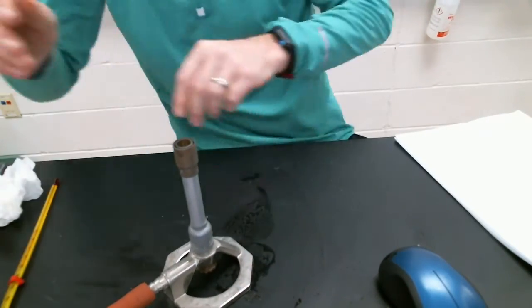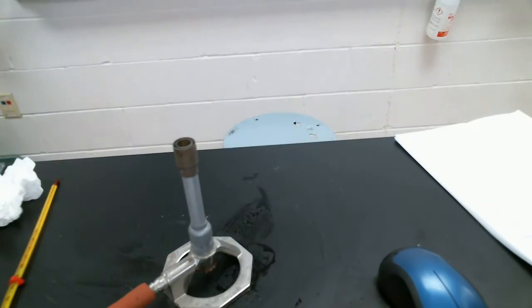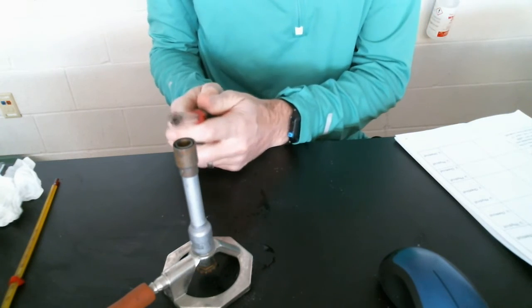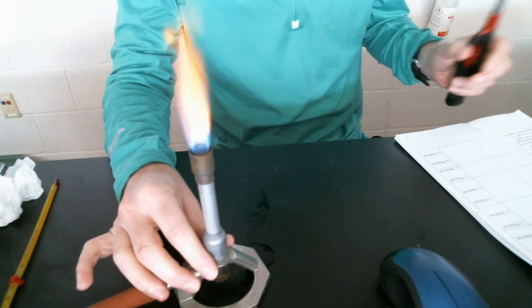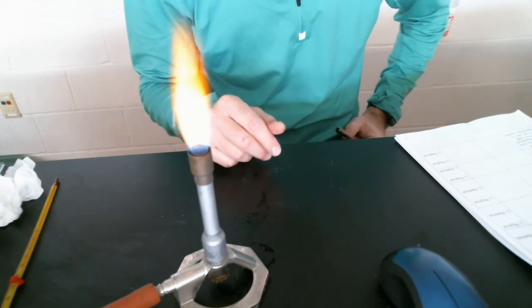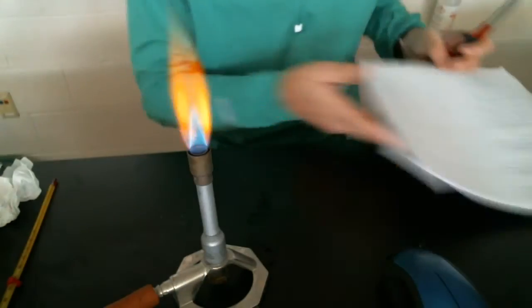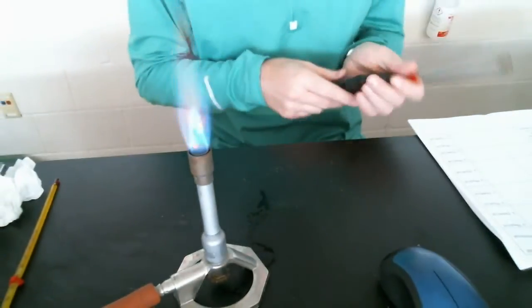And now for our last two, number 10 involves the Bunsen burner. So I'm going to go get the lights real quick. It makes it much easier to see this. Lights. And when I turn on my gas valve, out is going to come methane, which is a colorless, odorless gas. Actually, no, methane has a little bit of a smell to it. And there we go. That was that change, going from clear, colorless, to now pretty obviously giving off light. So what do we think for number 10? Chemical would be correct.